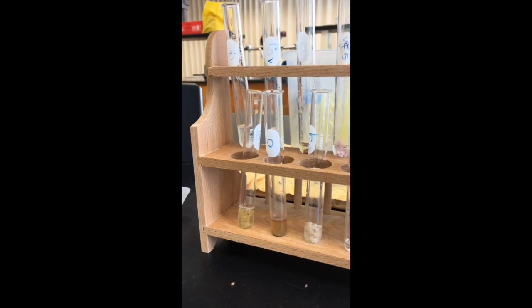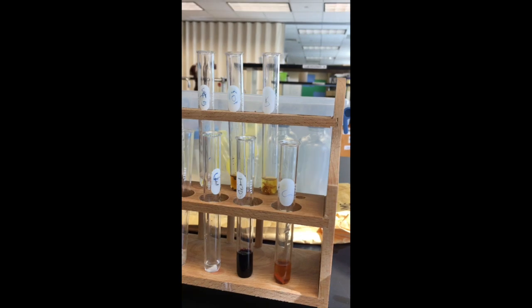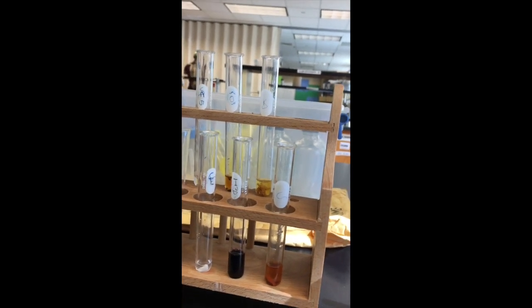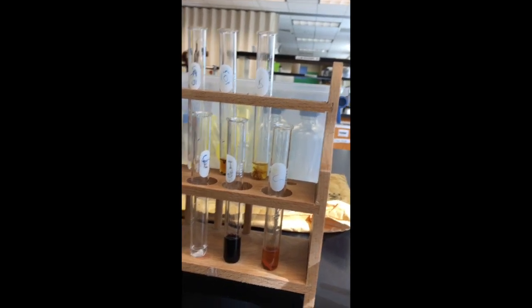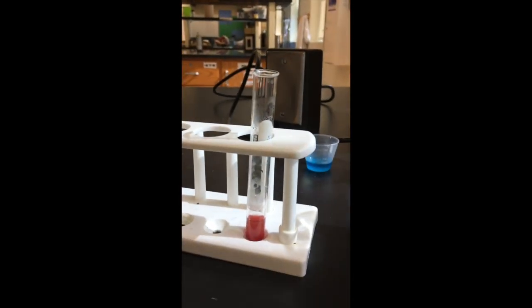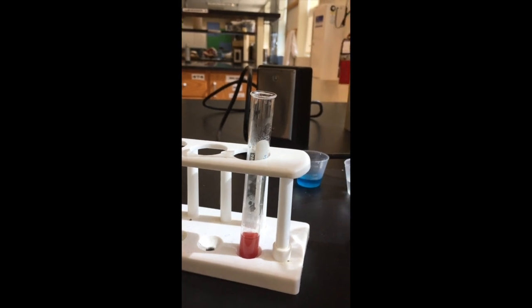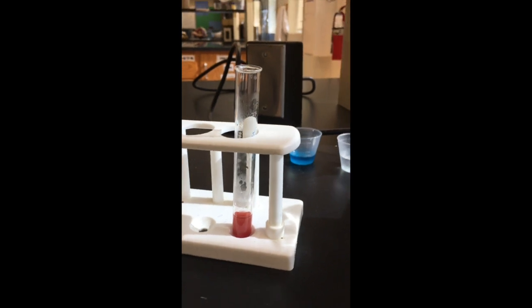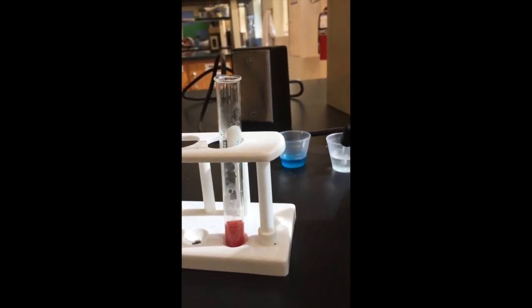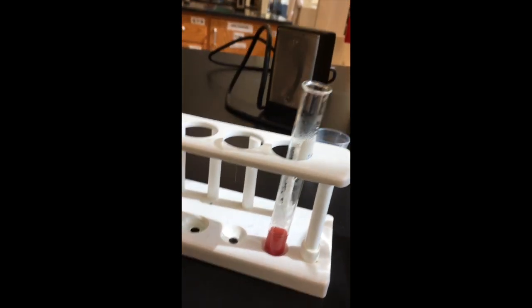But for what we have found, there are definitely complex carbohydrates in the bread, but not complex carbohydrates in the cheese, in the chocolate chips, or in the salami. Over here, the Benedicts definitely showed that there were simple carbohydrates in the simple glucose solution, and what we're finding now over here, as we're getting the heat moved up, is that in the bread, guess what?